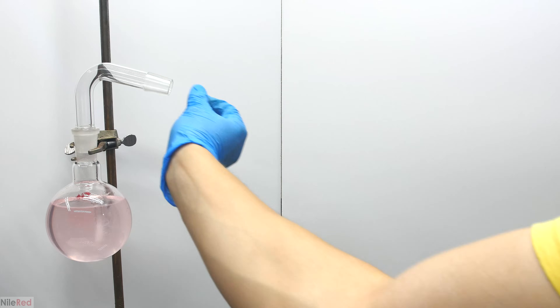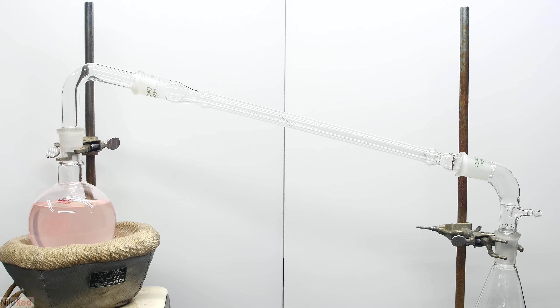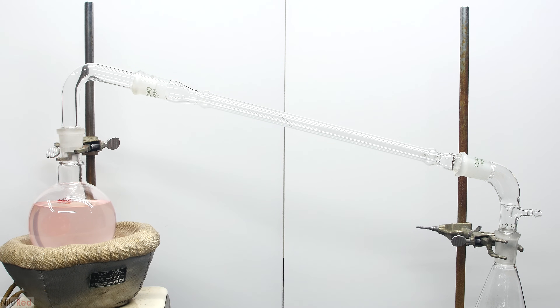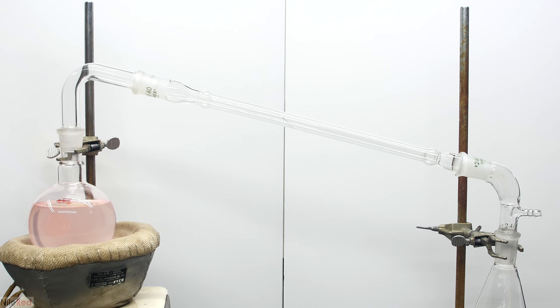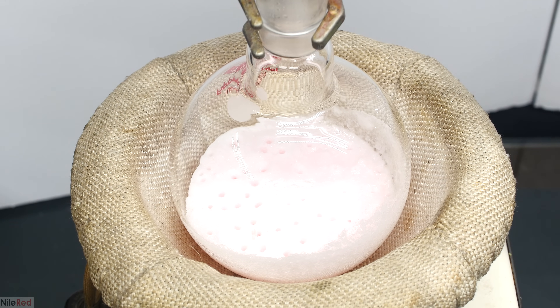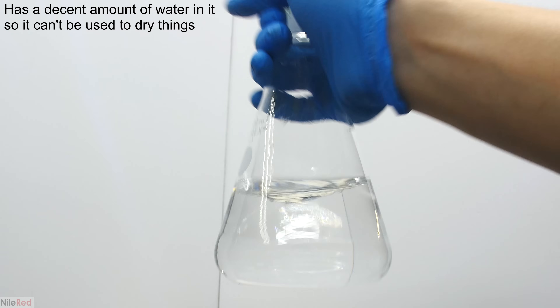Now we set things up for a quick distillation — I forgot to add a stir bar so I just chuck one in. What we want to do is distill off as much acetone as possible and recover the acetylsalicylic acid. In Chemplayer's video the acetone was simply evaporated in a dish, which is a completely viable method, but I wanted to recover the acetone which is why I'm doing a distillation. With heating and stirring turned on, we slowly distill off the acetone until we're left with a white cake, at which point the temperature should be turned down.